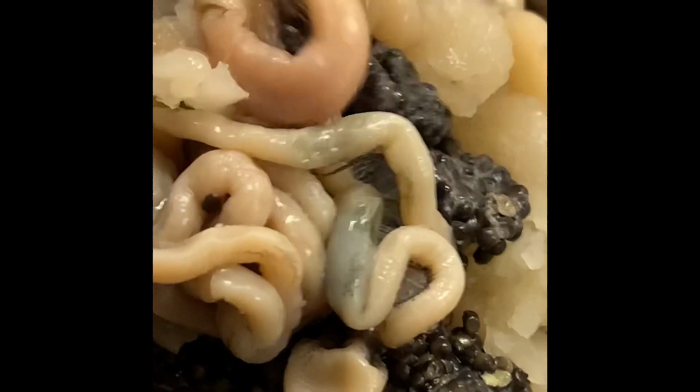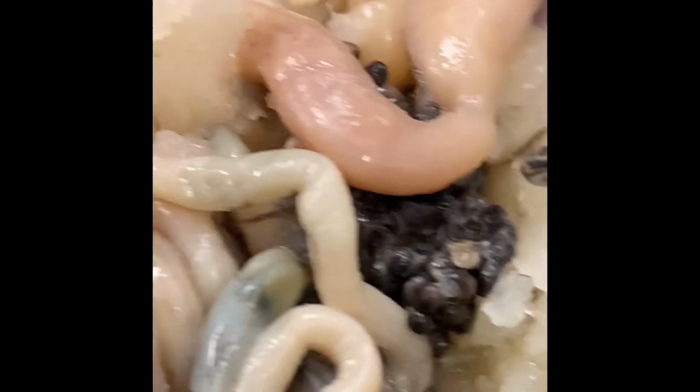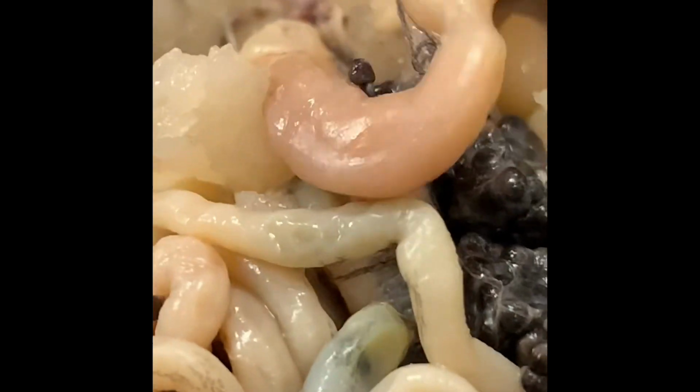Alrighty, and then the pancreas should have... There's a triangular thing right there under the stomach. Is the pancreas? It's a little ripped up because of our hack job. However, that's all right. Can you move it up one more time? Yeah, it's a little under there. Yeah, I got a good picture of that.